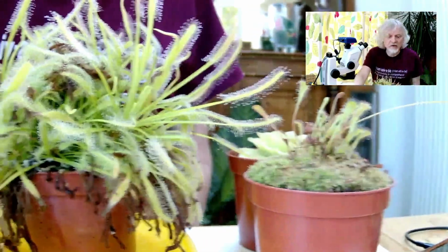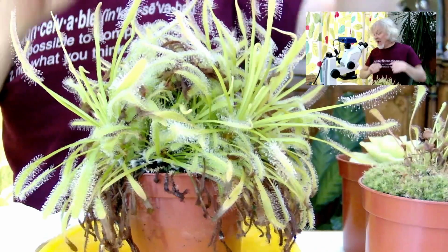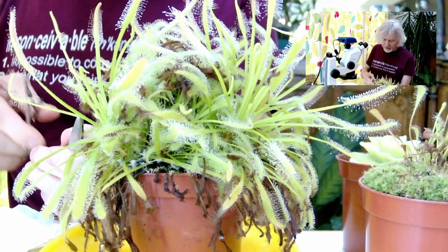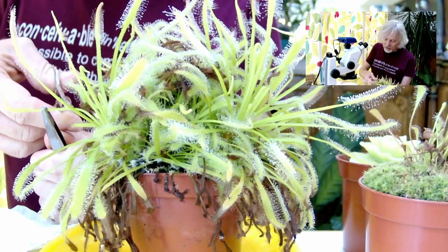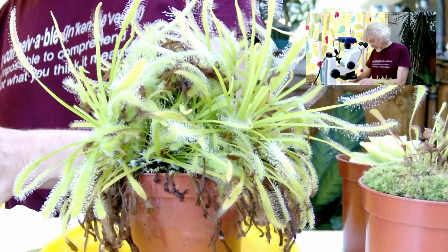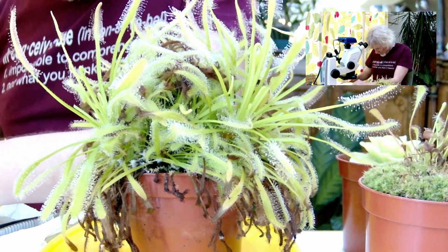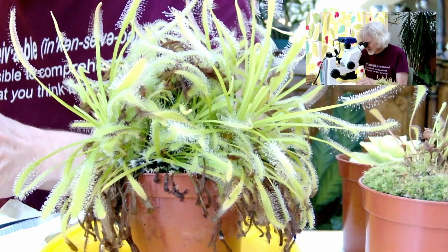And the first thing we're going to do is I'm going to snip a leaf off from the Cape sundew so I can put it under the microscope. And this is the leaf that I decided I was going to snip here. It helps if I snip the right side of the tweezers. There we go. That goes under here like that. It's very sticky.